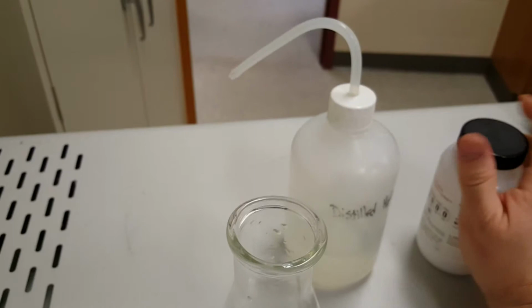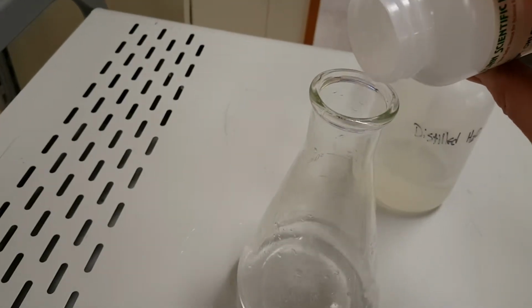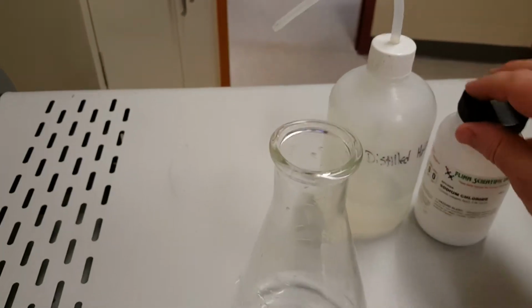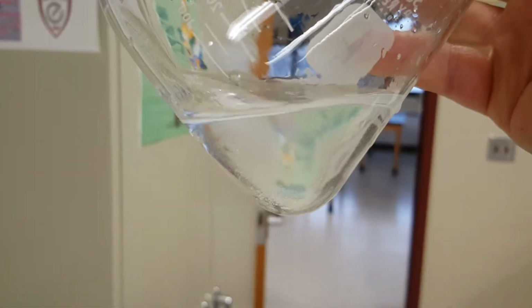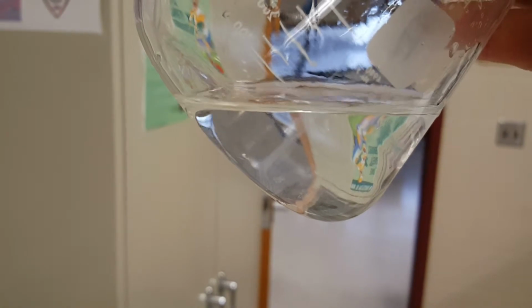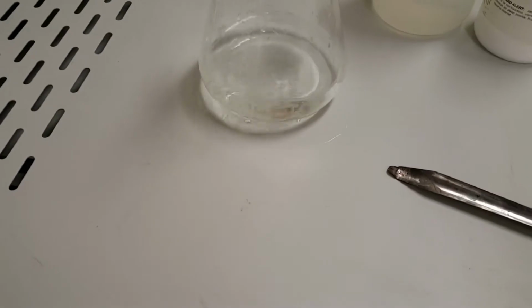And to prove to you that it does dissolve, I'll add a bit more. Okay, salt does a good job at dissolving. So there's plenty in there, right? I added a little bit, which made it dilute. Now I added a lot of it, which makes it concentrated. And at first it seems like there's some falling to the bottom there. But the more I swirl it, the more it mixes. You can actually watch the particles disappear and dissolve. That is dissolving. Now what's also happening at the atomic level is dissociation, but we'll get into that later.